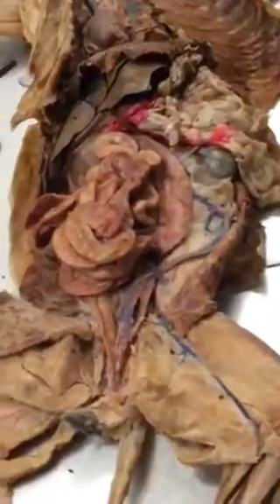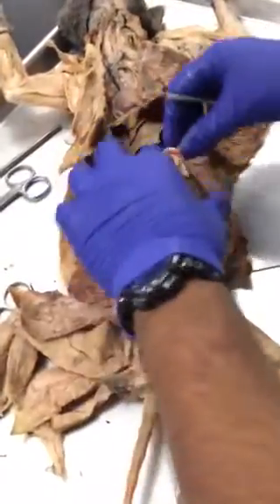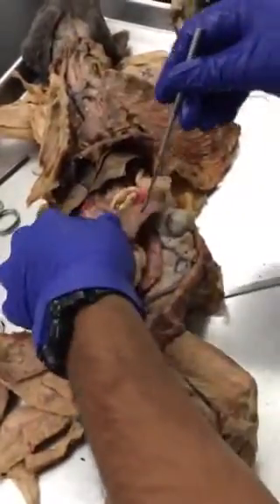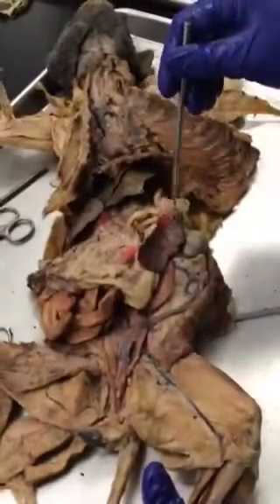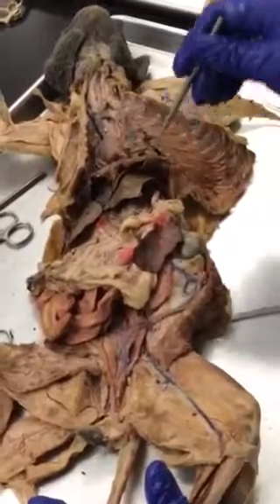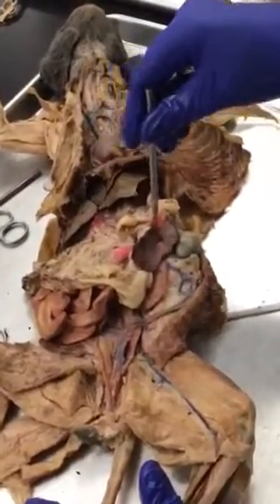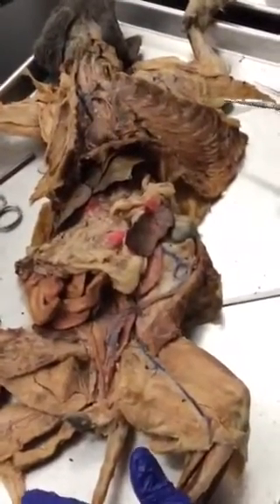Next is the spleen. The spleen will only be on one side. If you have a structure that looks like dried blood, surrounded by omentum, below the big lobe of the liver on the left side of the cat — that's the spleen.